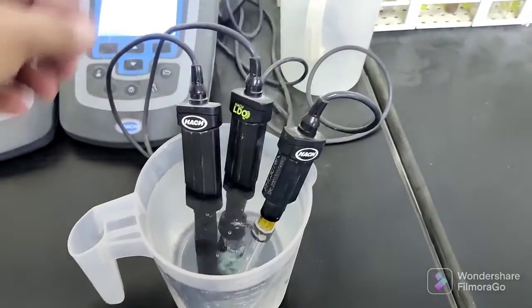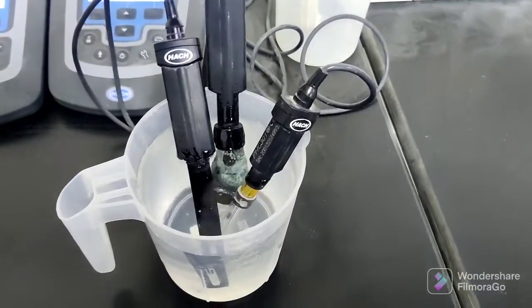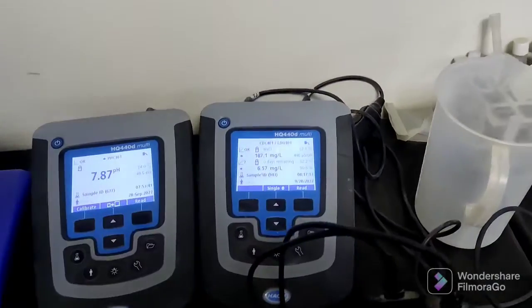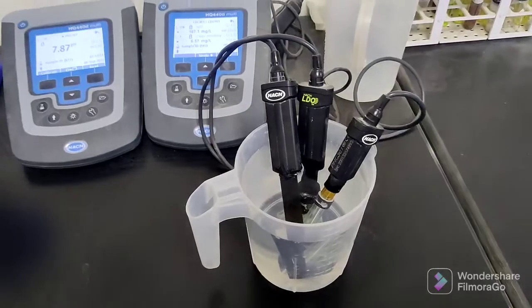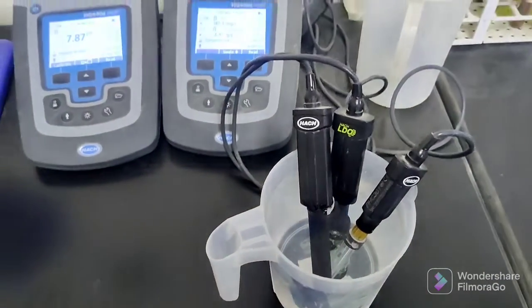Especially this one we are using for construction purpose, so everything we need to check very well. First we need a simple water sample here. Just check it inside the lab very well. For construction purpose we are using this, so these are the normal screens — you can read the pH, DO, and conductivity here.